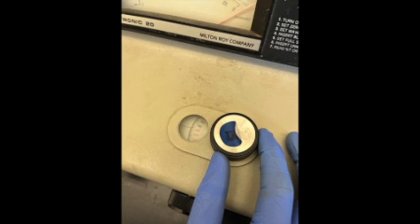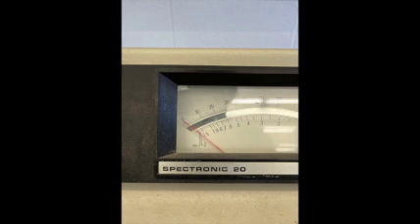Instructions will be provided on how to use the spectrometer. Turn knob B to the desired wavelength, which is approximately 600. Next, you will calibrate it. Turn knob A to 0 on the %T scale.